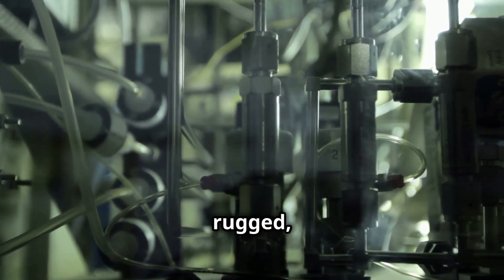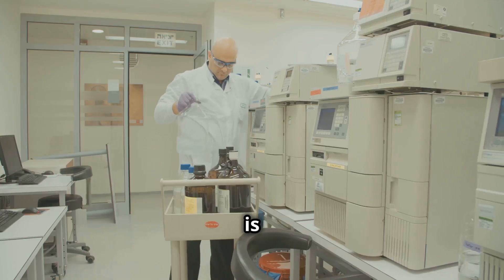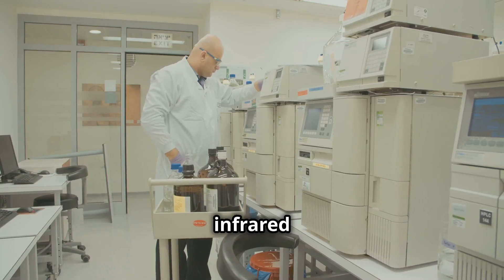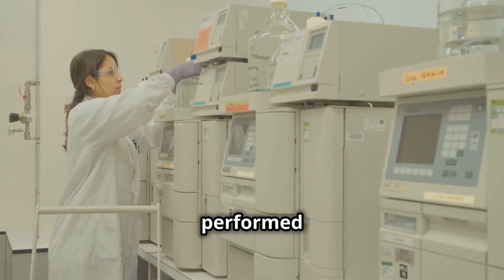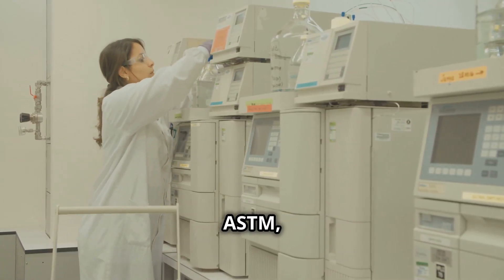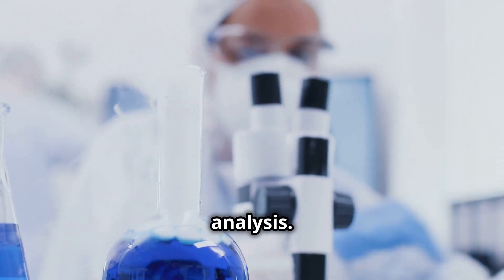Eraspec Oil is a compact, rugged, and lightweight FTIR spectrometer that delivers laboratory-grade results in monitoring lubricant conditions. It is the first truly standalone analyzer combining advantages of infrared oil condition monitoring — like fast and reliable results — with high portability. Measurements can be performed directly on-site, and the results are available within a few seconds following ASTM, DIN, and JOAP methods. With Eraspec Oil, there is no need for sending in samples for analysis.